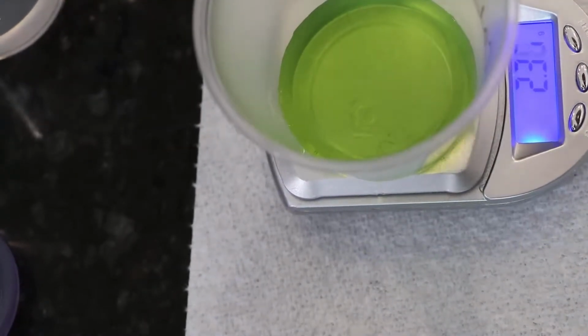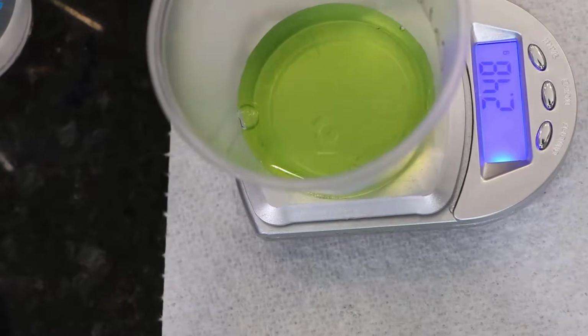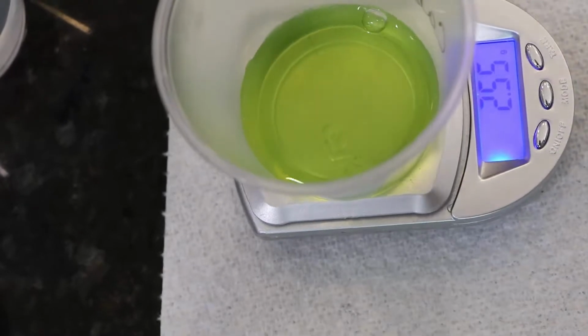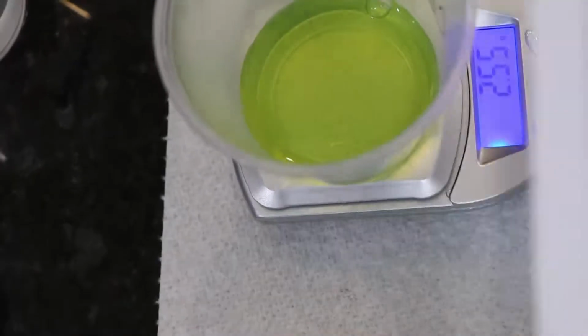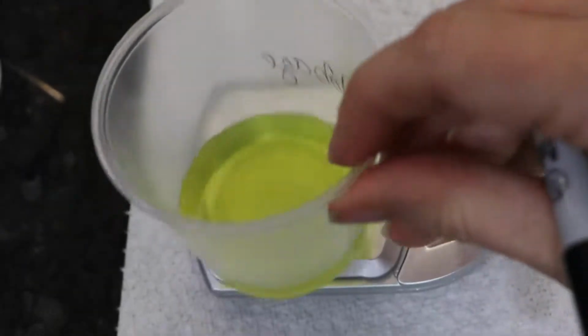But you need to watch for the turbidity here as well. So that transition occurs here in just a few drops, and again, the camera didn't quite pick it up, so you're going to have to trust me that there was a little bit of turbidity. And once you see that turbidity, the mass of the sodium hydroxide that you've added goes in titrated mass 2. Again, you're not going to have a titrated mass 1.